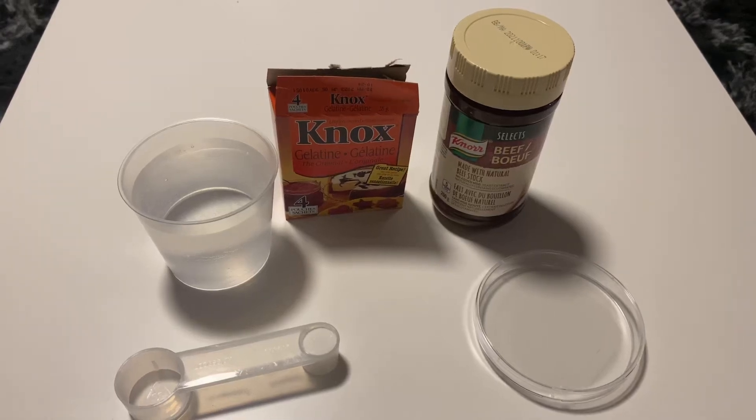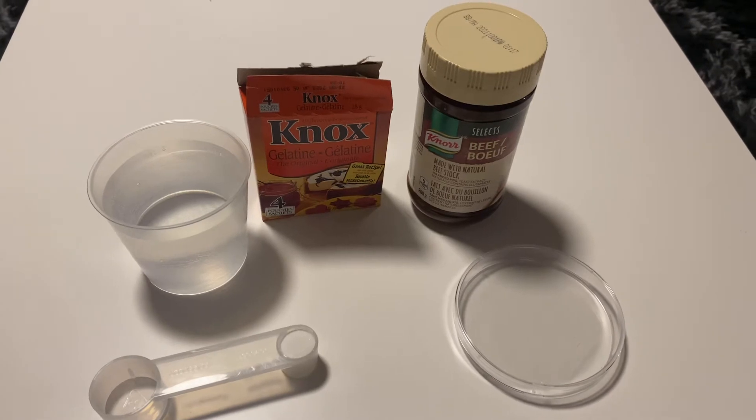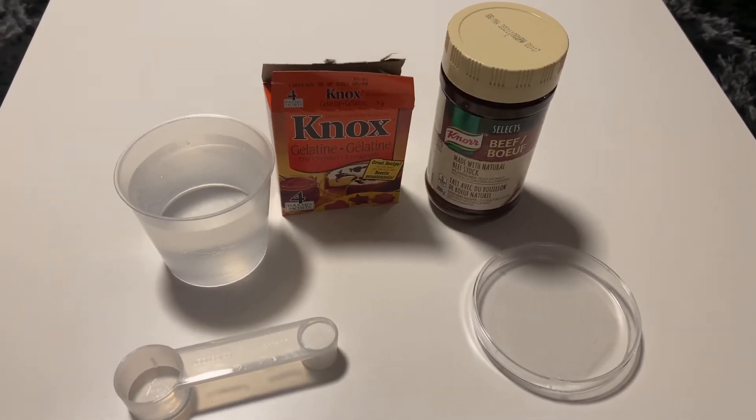Hello, I'm Litvija Kolaku. In this project we are doing homemade agar preparation and surface sampling.